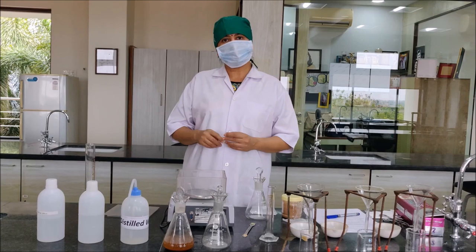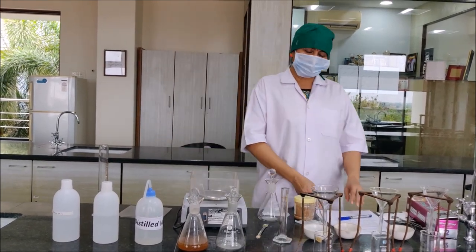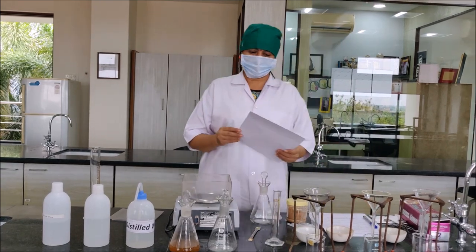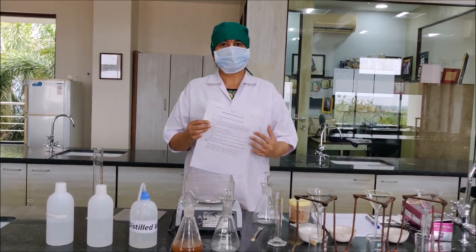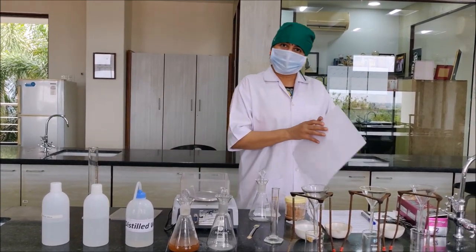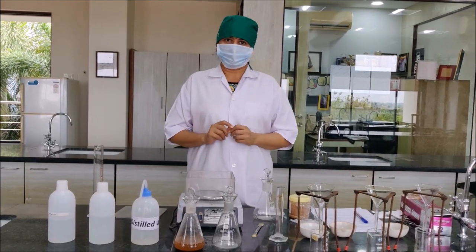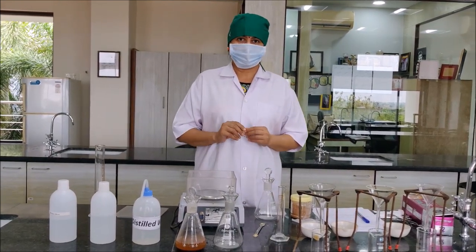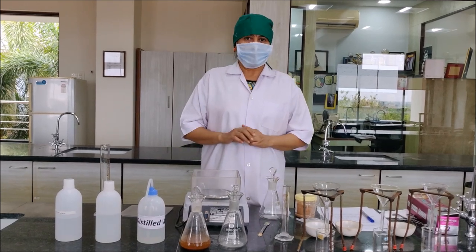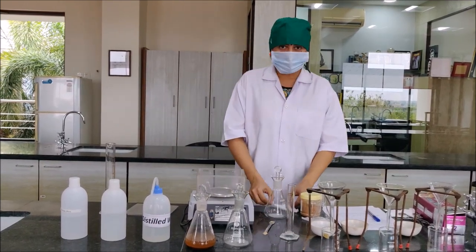Hello everyone, welcome to the learning episode of Pharmacy. Today we are going to perform the practical in Pharmacognosy and Phytochemistry 1, that is determination of extractive value. I have already told you what extractive value is and why we do that — how it is useful. Now I am going to show how to evaluate the extractive value. So let us start the procedure.